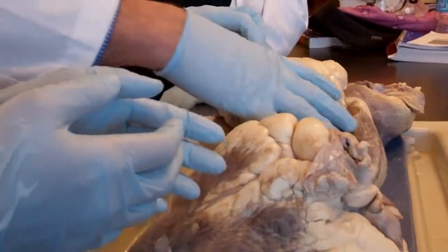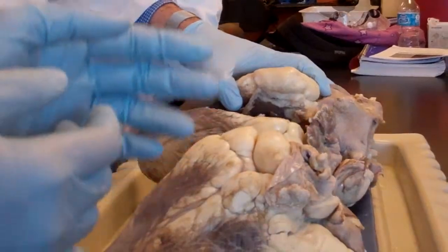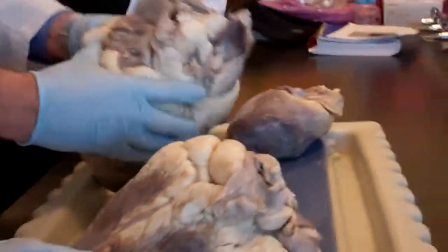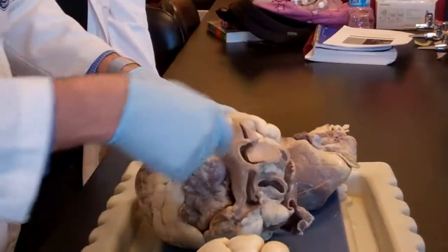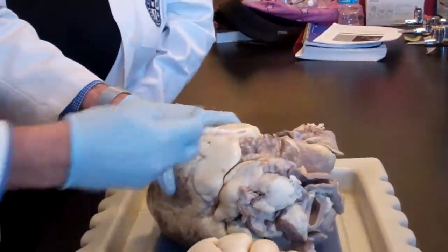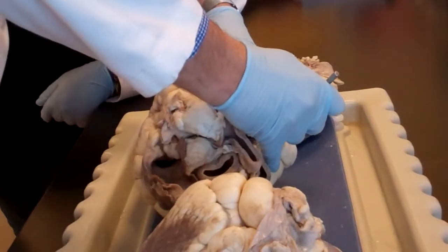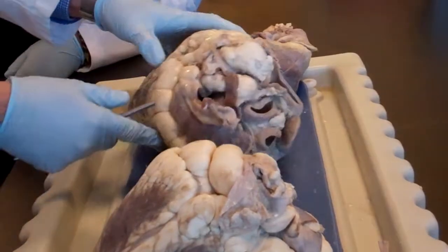And then we have the last thing to identify, which is the coronary artery. Here are the cross sections. So technically, the coronary arteries are this way. My hands are not that big, but you get the idea. They coronate the heart like a crown, and then you can see very clearly the cut-off section right there. See that opening here? That's the cut part of it.